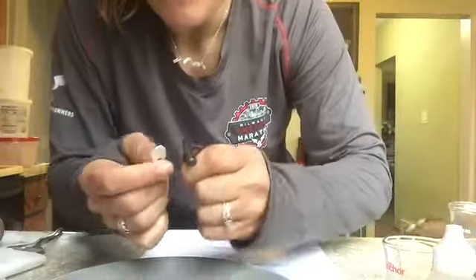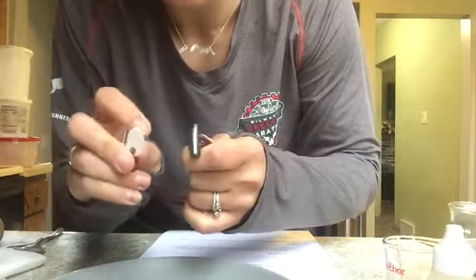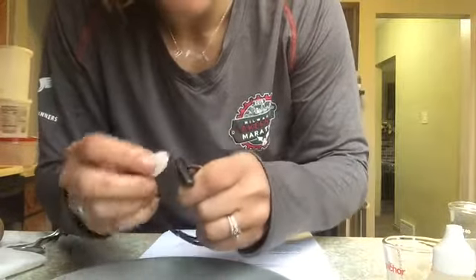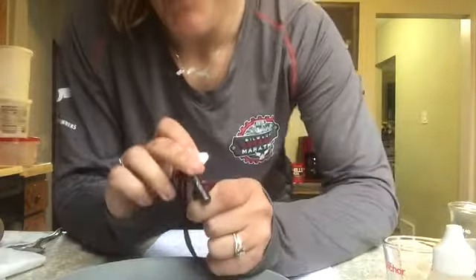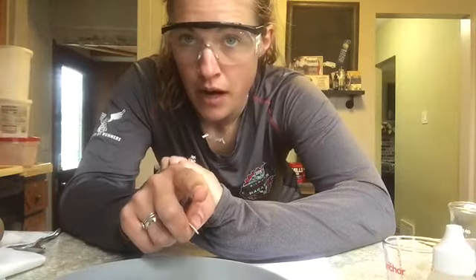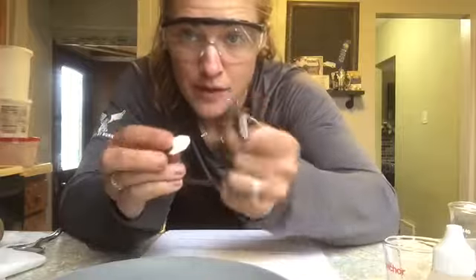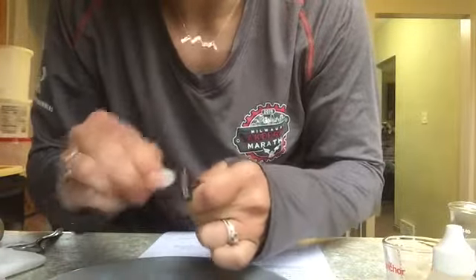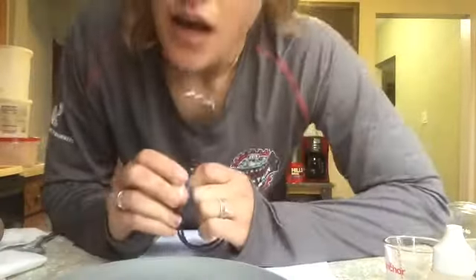Okay, so with my fire starter, basically what you're doing is you're taking this piece of ceramic or something really hard, usually like a rock or a flint, and you're gliding across a magnesium bar. So if you guys remember the first video lab, I showed lighting magnesium on fire. Magnesium is really, really flammable, so that's actually what creates a spark. So we can do that and create our little sparks. I don't know if you can kind of see me throwing them off there.